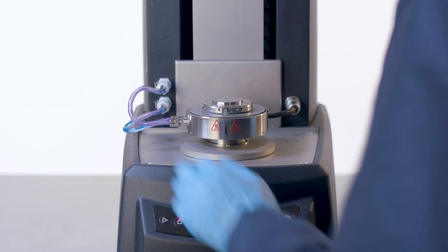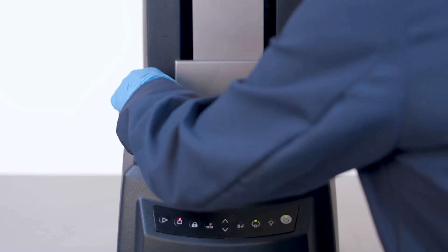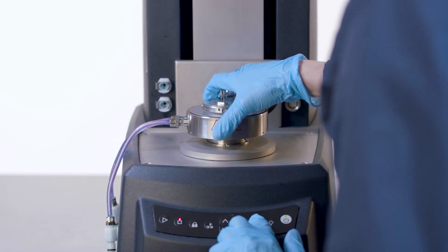The powder accessory is easily interchangeable with other smart swap accessories. Press the release button to swap the accessories.